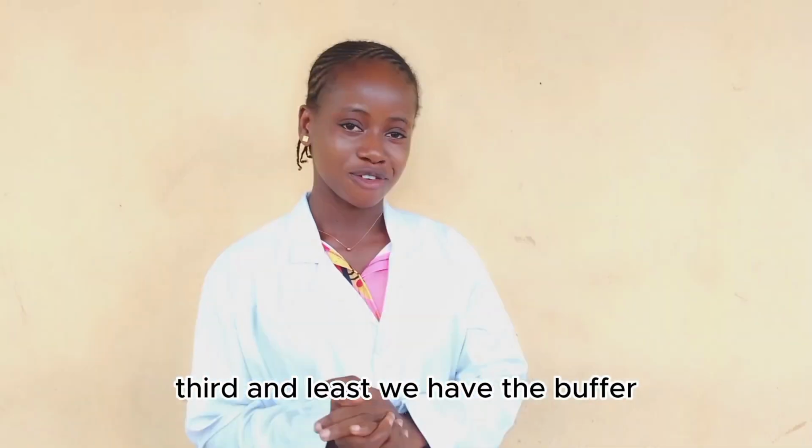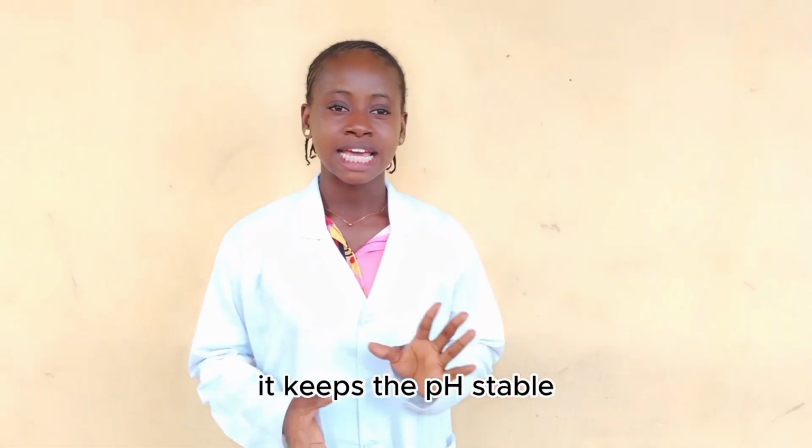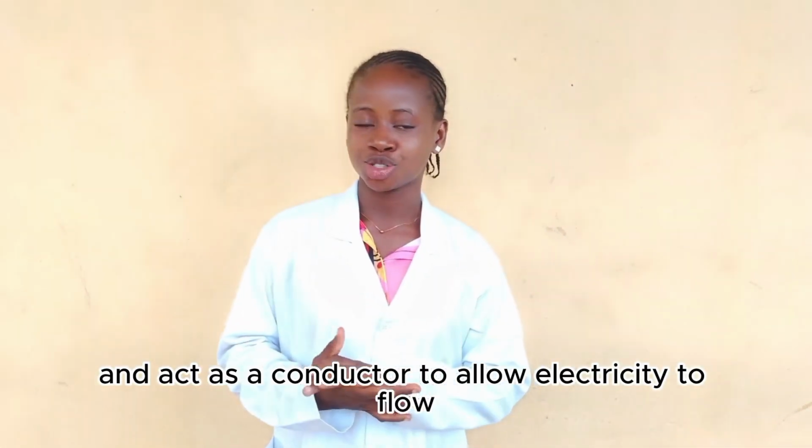Third on the list, we have the buffer. The buffer, this is the liquid we pour over the gel. It keeps the pH stable and acts as a conductor to allow electricity to flow.